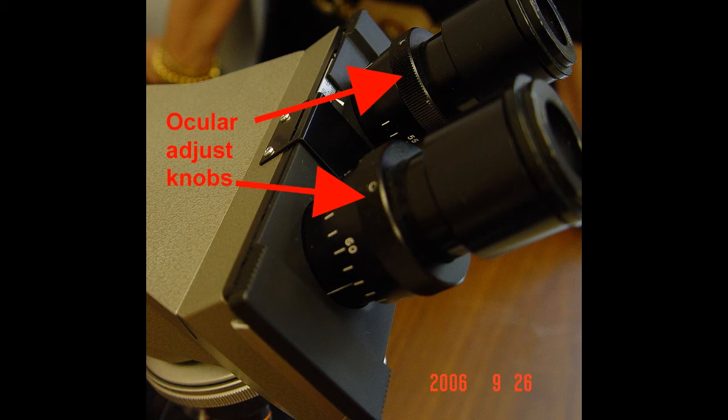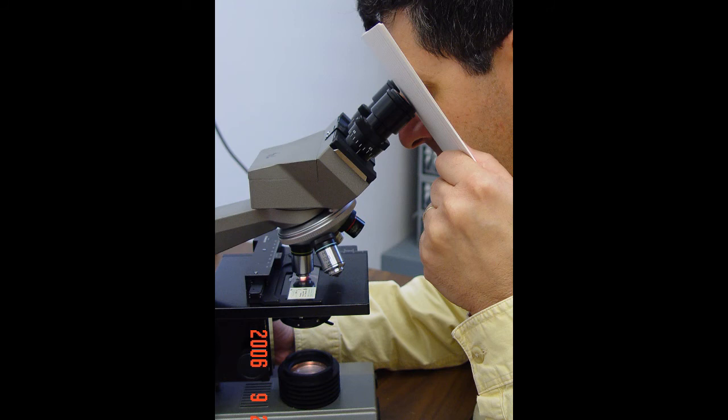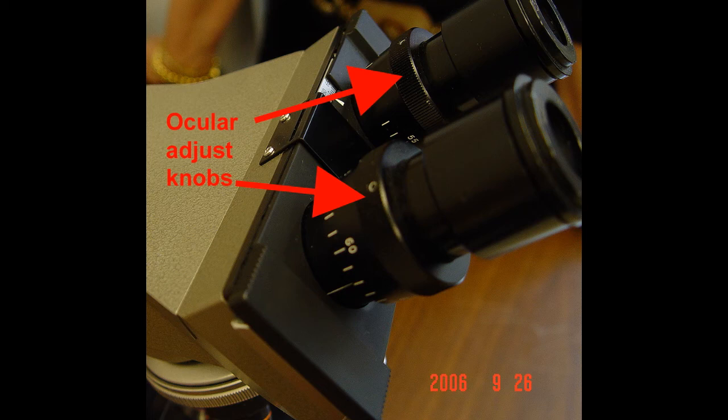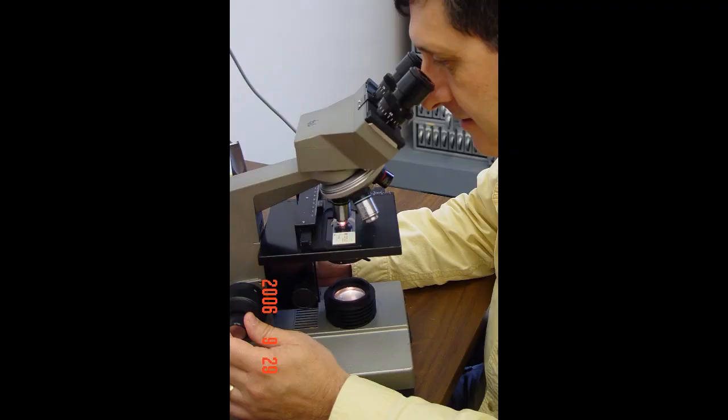So if mine is 62, what I would do is set my left ocular to 62, block my left eye, look into the microscope just with my right eye, and get a very sharp focus with the fine focus control knob. Then I would block my right eye and look through the left ocular. At this point I would not use the fine focus control, rather I would use the adjustment on the ocular lens, that little knurled knob on the ocular lens, to bring the image into focus. When I have a sharp image, then looking through with both eyes, I will have a fairly sharp image and I will have the oculars adjusted for if my eyes see at different strengths.